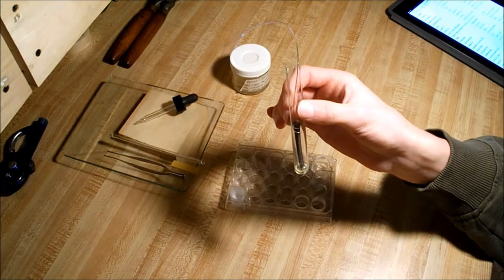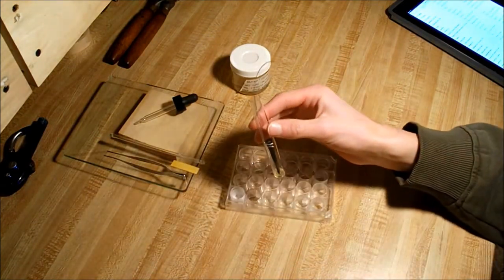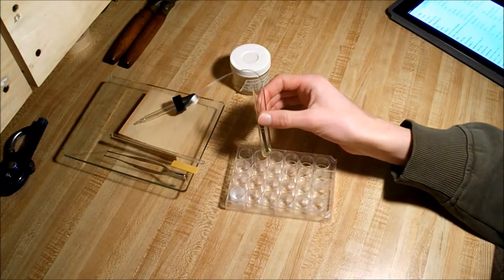As you may see now it's already starting to fizz a little bit. And we'll let that go while we do the other two experiments.